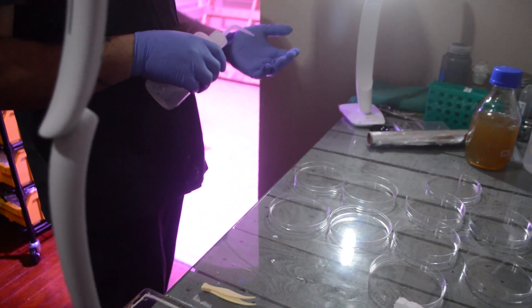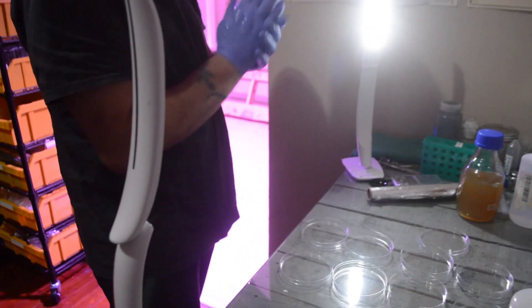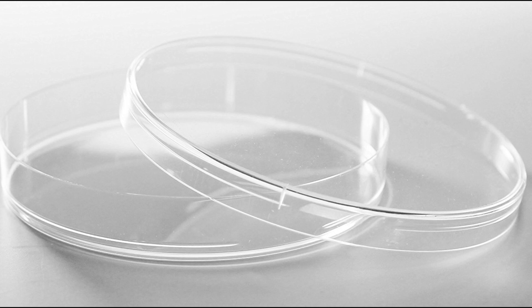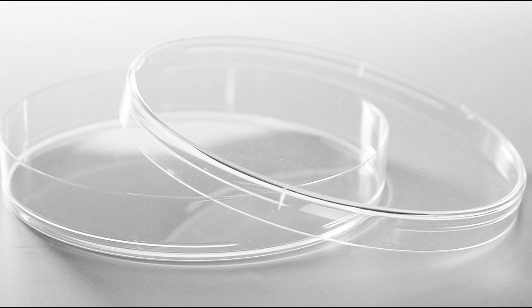Before you open anything or touch anything, put on gloves and spray down the bench with ethanol, as well as the agar bottle and your hands. Now get your petri dishes ready. You'll use different sizes based on what you're doing. The dishes must be sterile — most of the time when you buy petri dishes they come pre-sterilized, but not always so be sure to check. If they aren't sterile you'll need to soak them in chlorhexidine solution or ethanol and let them fully dry before pouring your plates.